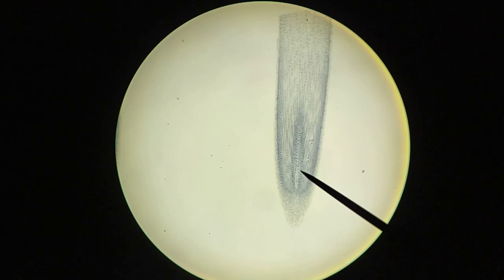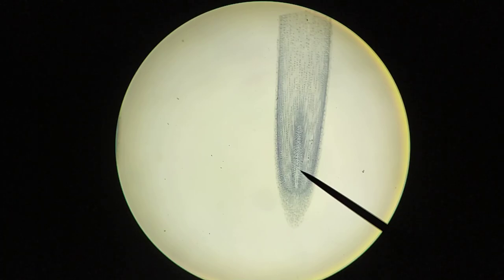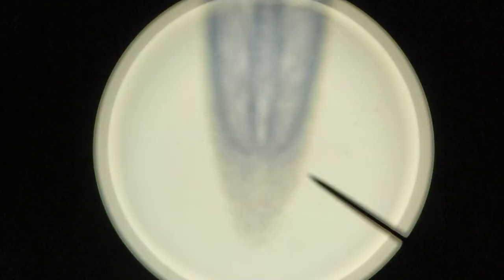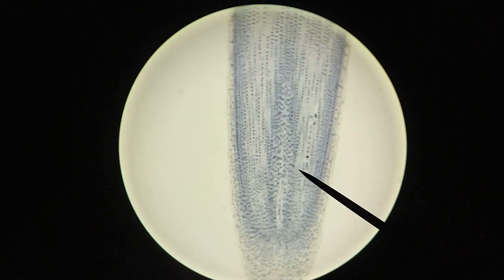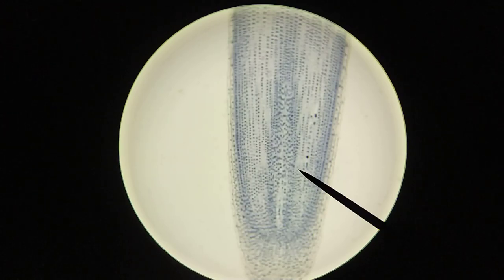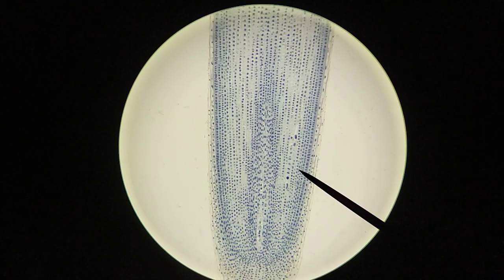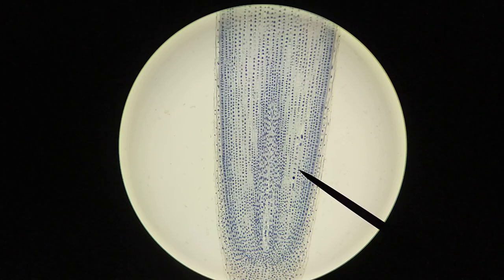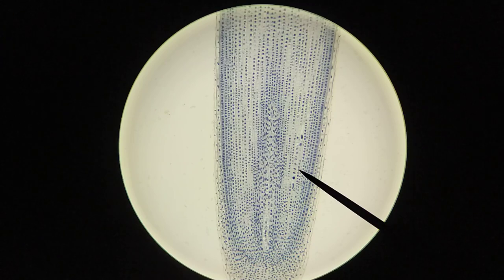Having looked at this at the lowest magnification, I'm using the 4x objective, so the total magnification is 40x. I'm going to switch over to the 10x objective to zoom in a bit. You can see how we've magnified this substantially. Here is the root apical meristem, and you notice there are some differences in the appearance of these cells - some look a little bigger, some smaller. At this point I can tell there's mitosis going on, but if you don't know what to look for you might just see differences in little dots and squiggles.